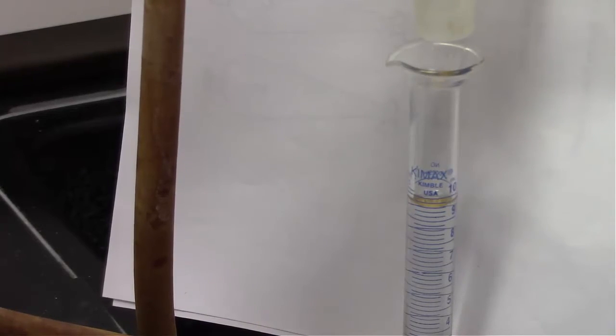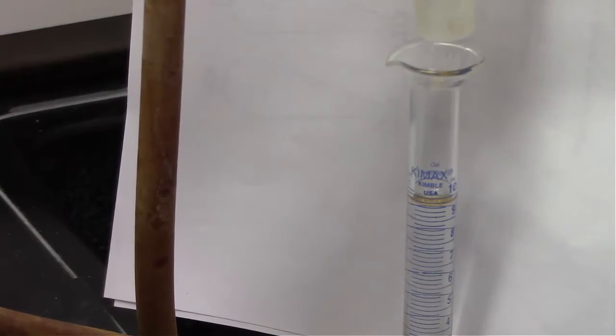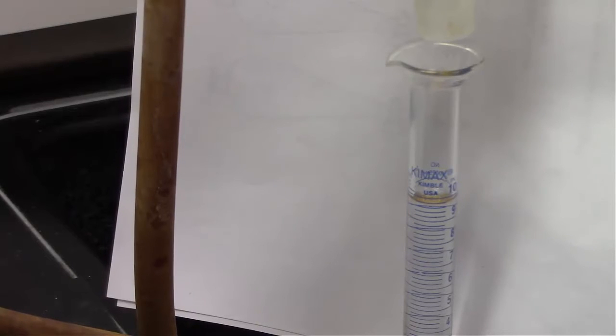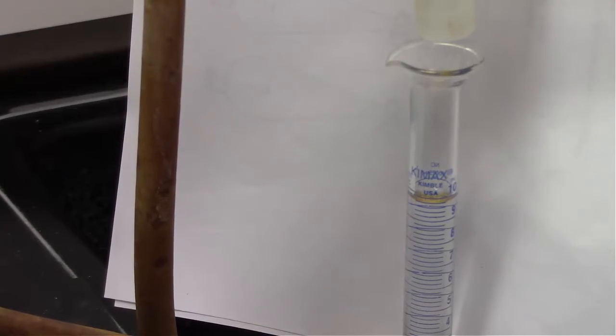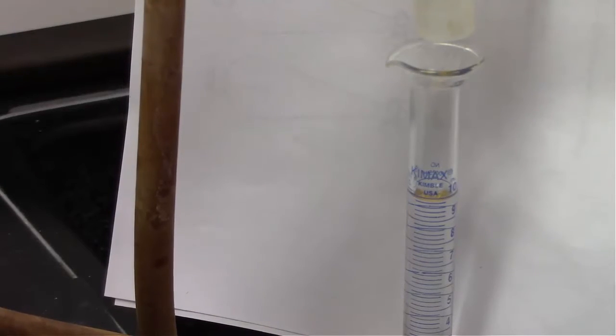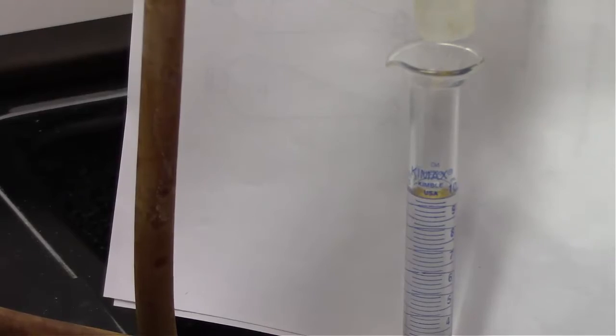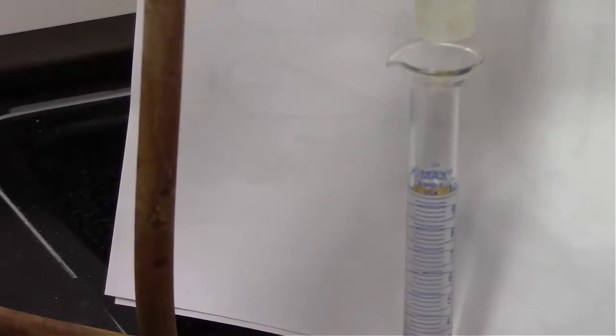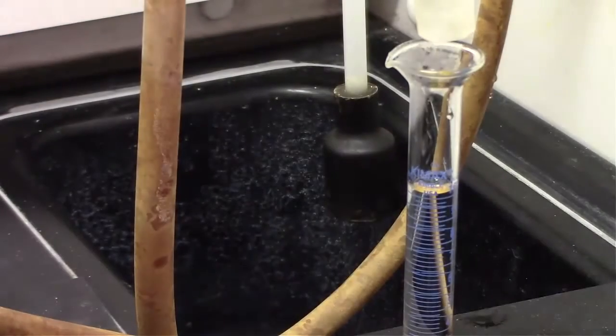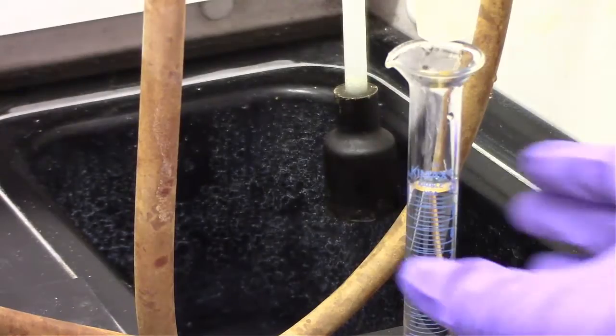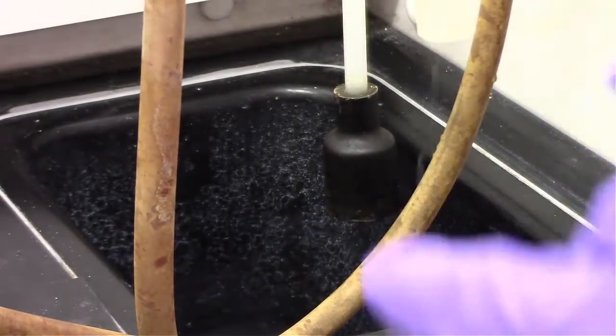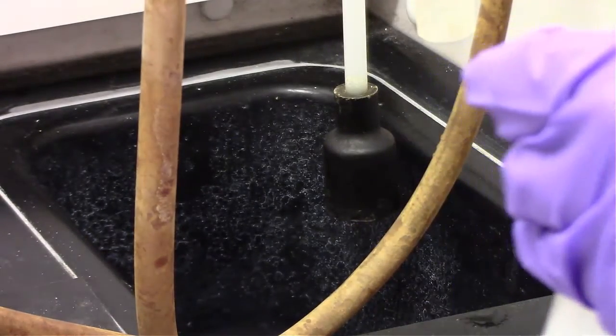So we're almost to 10 milliliters, and in this 10 milliliter graduated cylinder that's pretty much all we can measure. So now would be a good time to go ahead and dump that out very quickly so we don't miss too many drops. Put that back in so we can continue to monitor the temperature versus volume collected to graph our data.